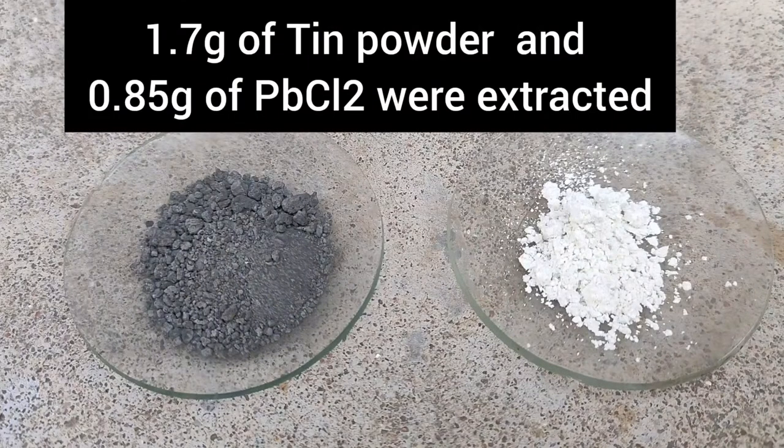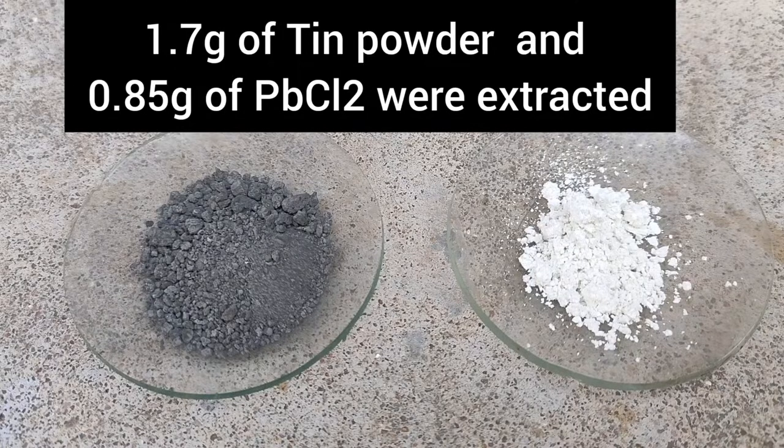This is the final yield of tin and lead chloride. 1.7g of tin and 0.85g of lead chloride were extracted.